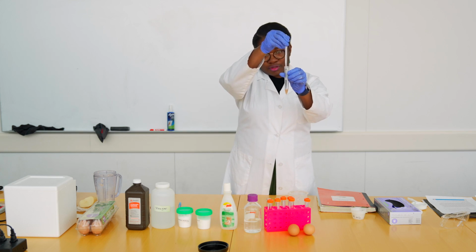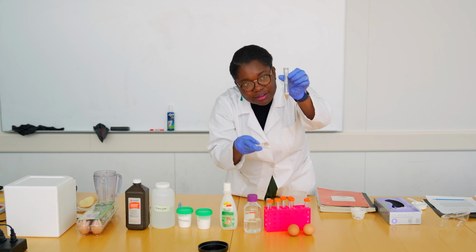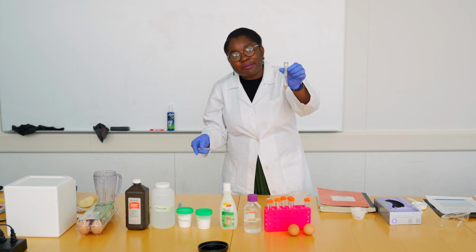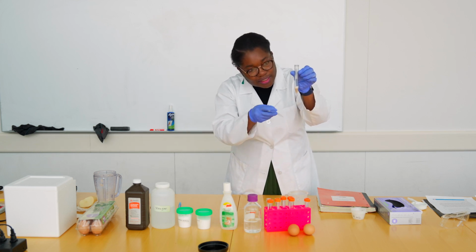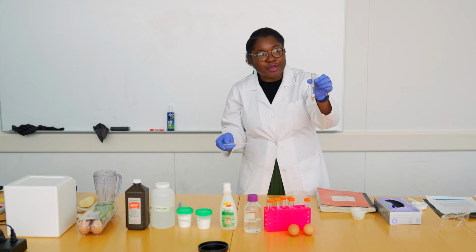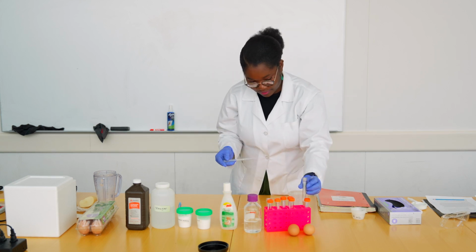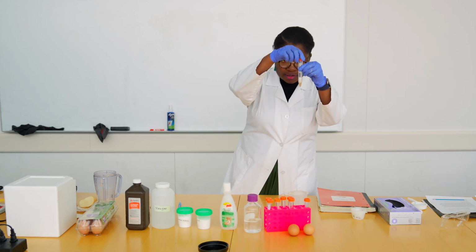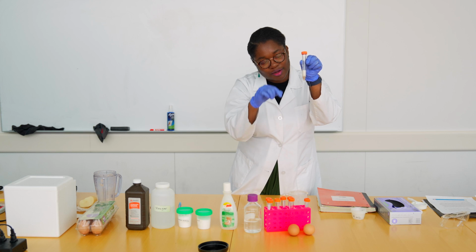So we can drop a couple drops of hydrogen peroxide. I'm dropping 10 little drops. And as you can see already, it has started bubbling. You see a foam that is rising up. What I want you to do is let this stay for a little bit until you don't see the bubbling anymore, and you're going to measure the height of the foam. There we are, it's still bubbling, and as you can see, the foam is still rising. We're still getting quite a bit of that.